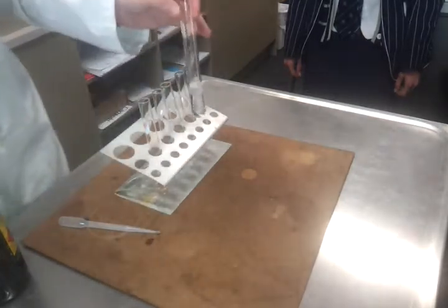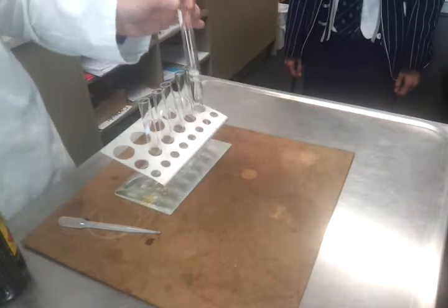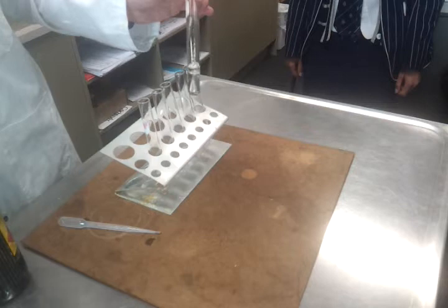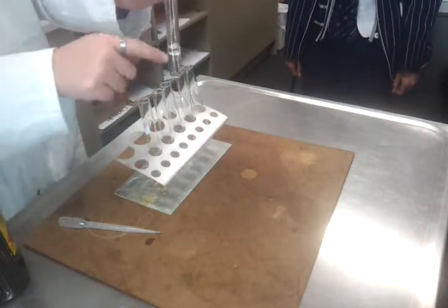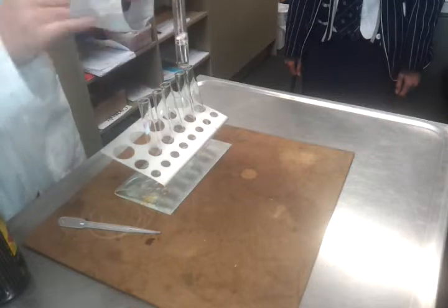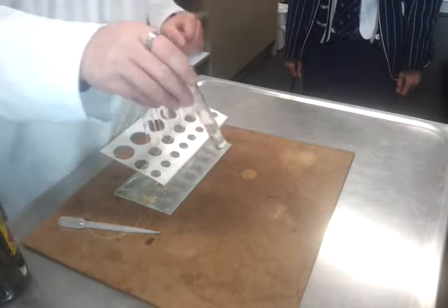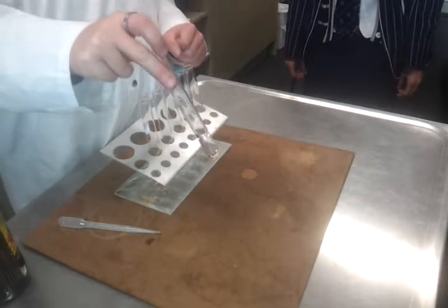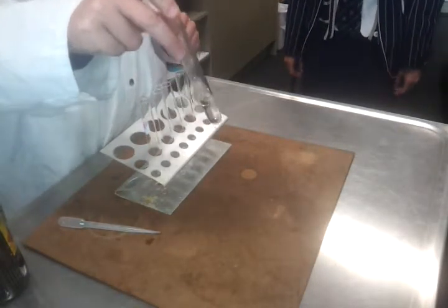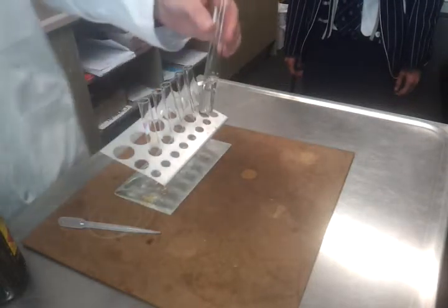And we can see quite easily there that it's gone all bubbly down here, where some air from me shaking it has been caught, and we've got a small layer on top and a big layer on the bottom. Remember that the water was that size to start with, so it's showing that it's not dissolving at all in water. The word we use for this is immiscible. So when a liquid won't dissolve in water, we call it immiscible. I-M-M-I-S-C-I-B-L-E.